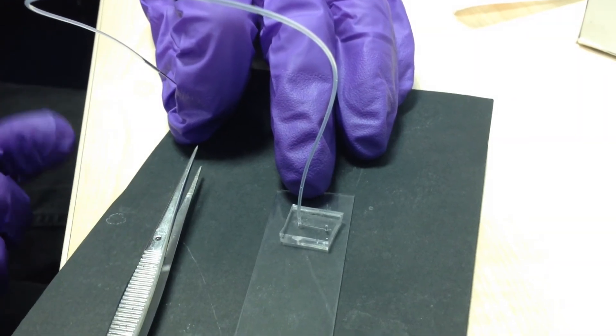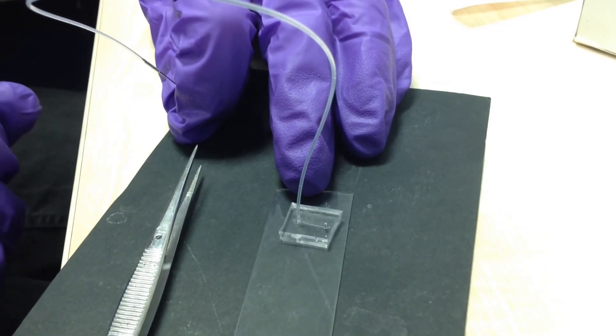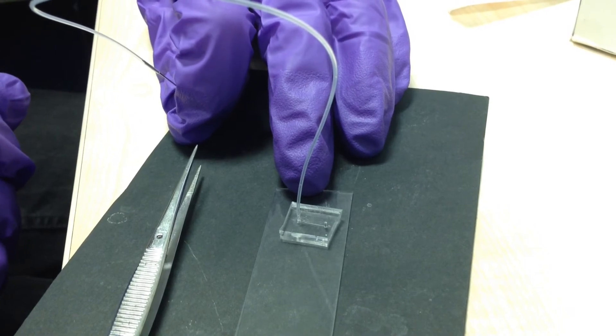It's quite a tight fit because the tubing is very slightly larger diameter than the hole to make sure it's a leak-free seal.